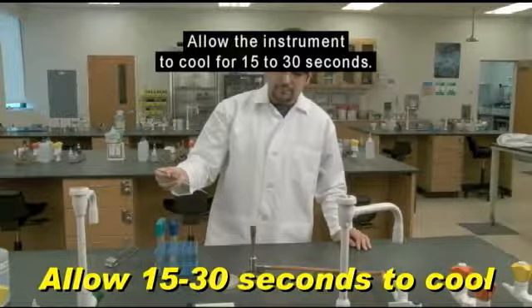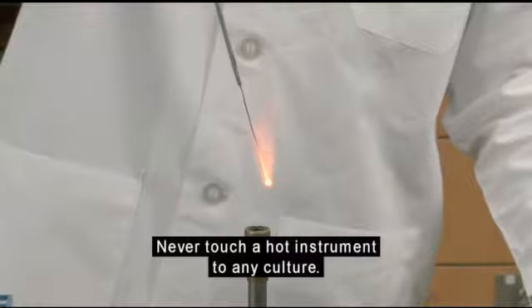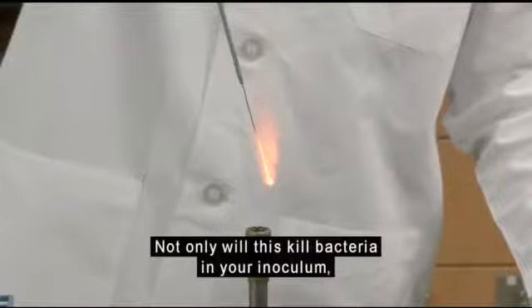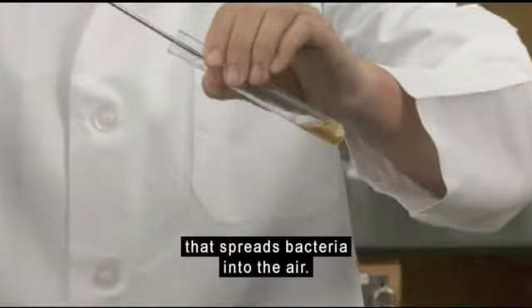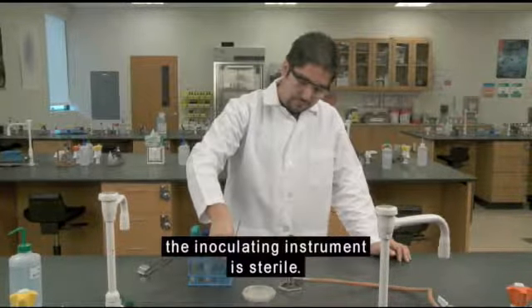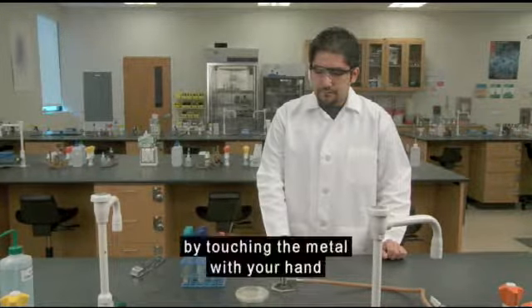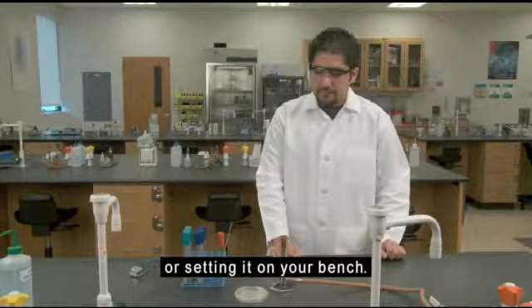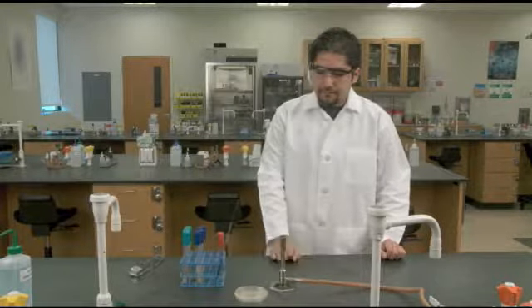Allow the instrument to cool for 15 to 30 seconds. Never touch a hot instrument to any culture. Not only will this kill bacteria in your inoculum, but it can create an aerosol that spreads bacteria into the air. Once properly flamed, the inoculating instrument is sterile. While it's cooling, don't recontaminate it by touching the metal with your hand or setting it on your bench. If you need to set the instrument down, use a rack or a stand.